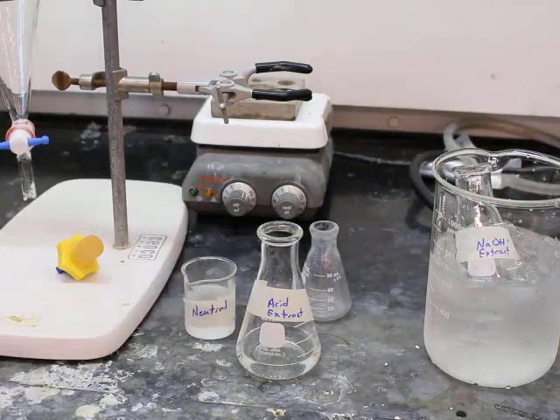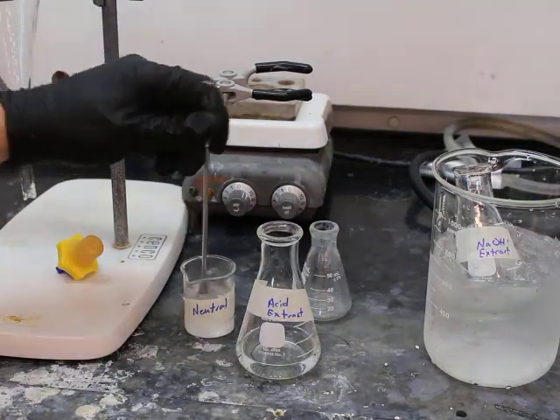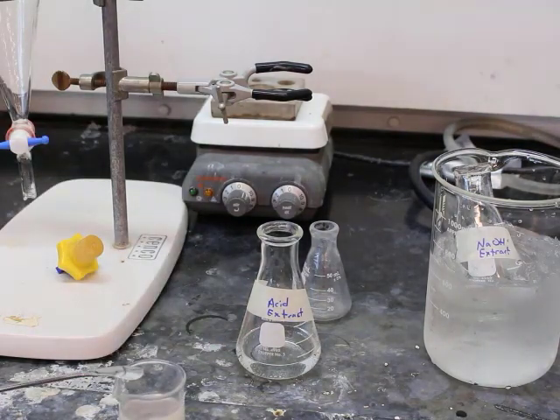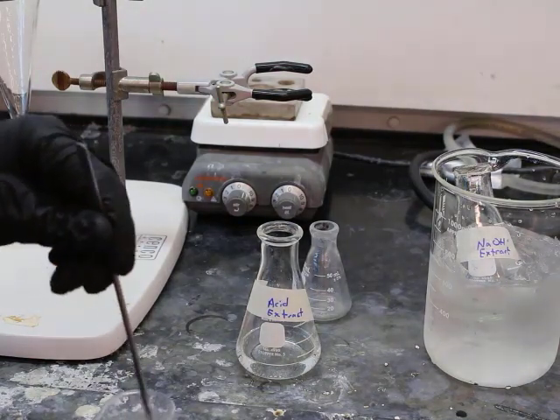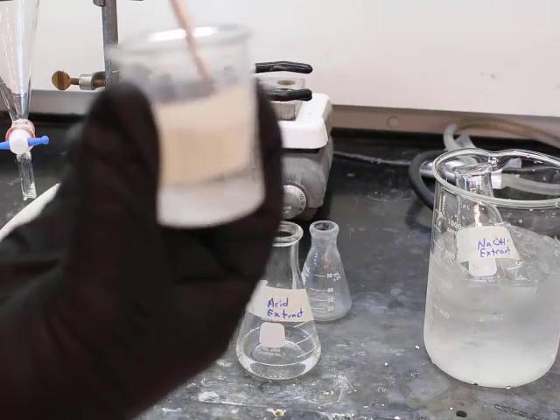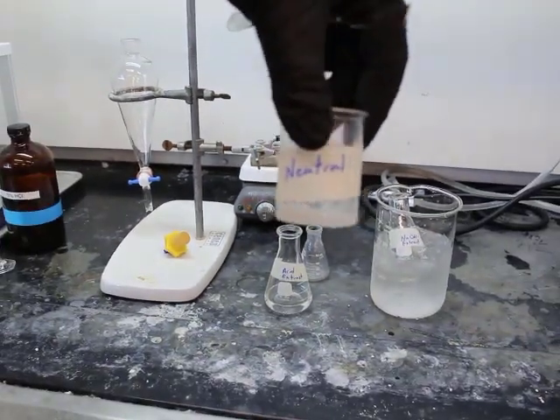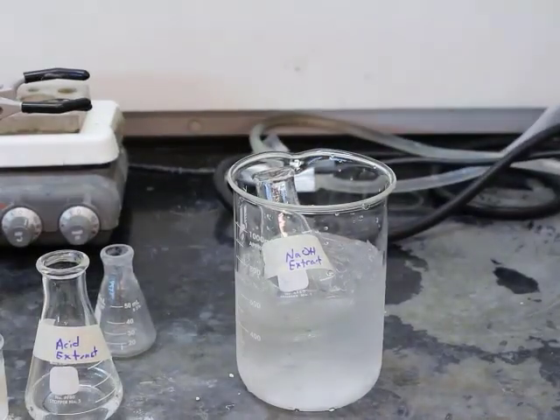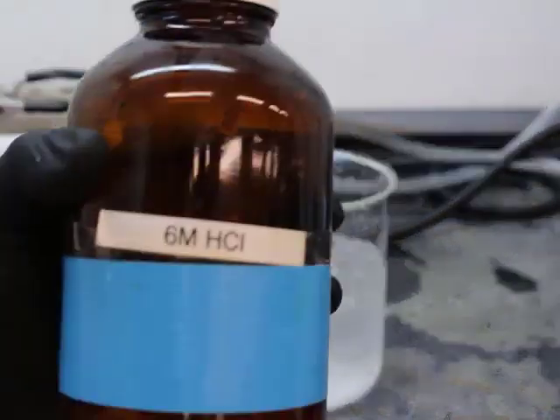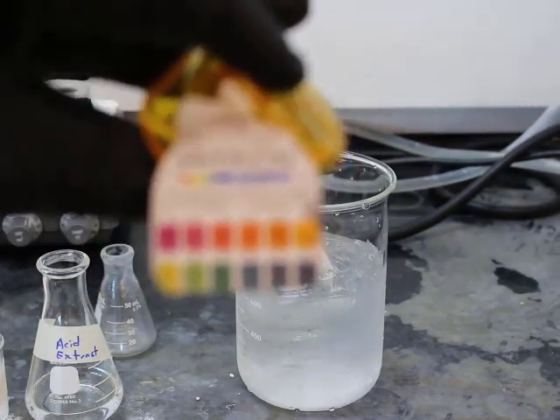In that neutral extract beaker, we have added a drying agent, sodium sulfate, which is going to absorb any water or aqueous anything that got left behind in the organic layer. You want to add enough sodium sulfate to where you still have a whole lot of fine looking powder.